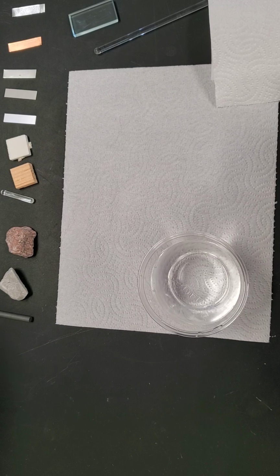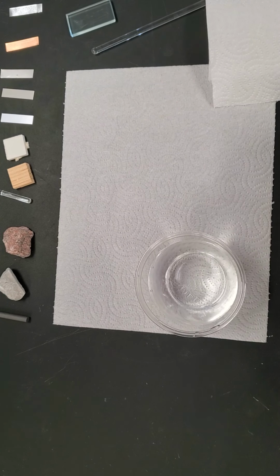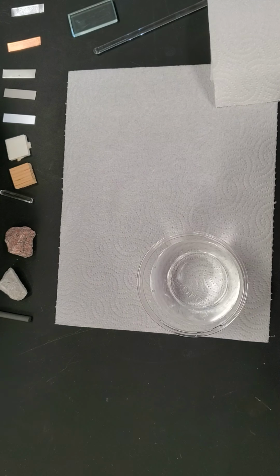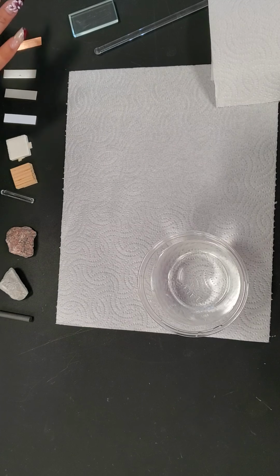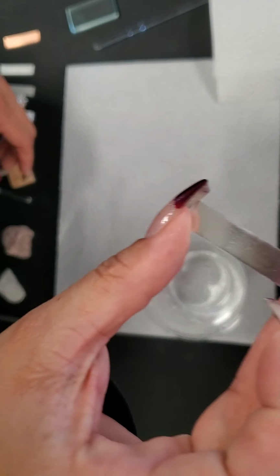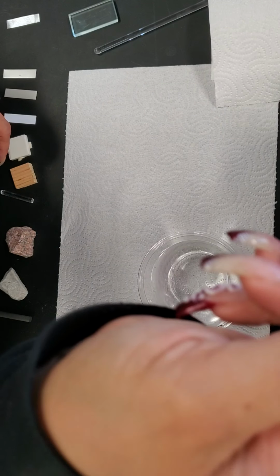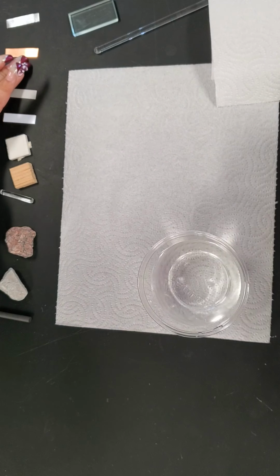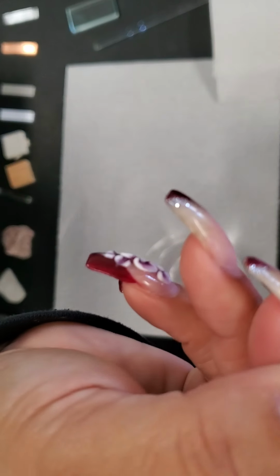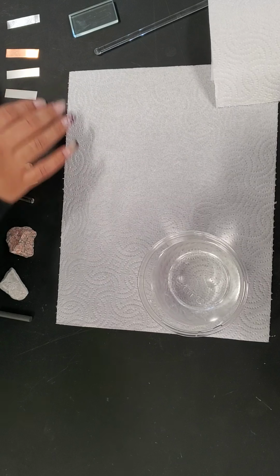So luster. We actually talked about luster a little while ago. We were talking about this earlier. We mentioned it with some of the substances. The aluminum is very shiny. The copper is also shiny. The iron has a little bit of shine to it. It's a little dull, has a little shine. It's nowhere near as shiny as the aluminum.